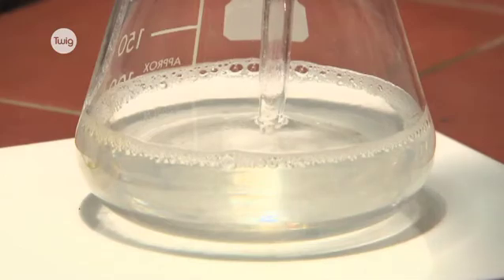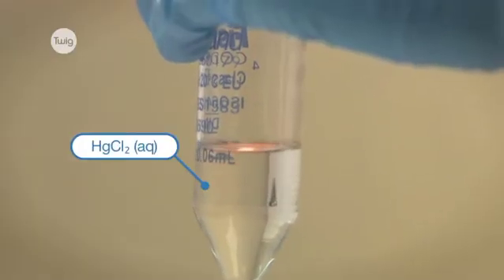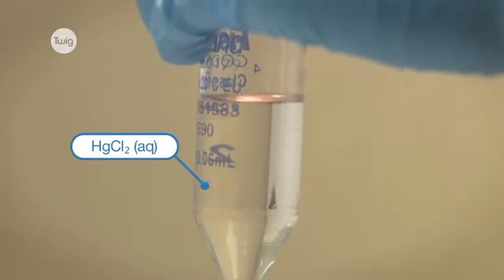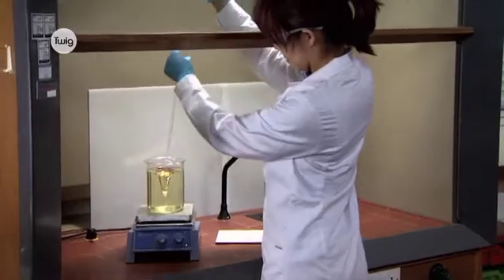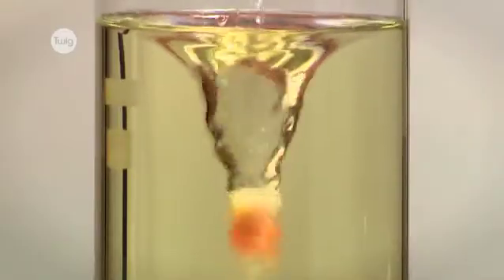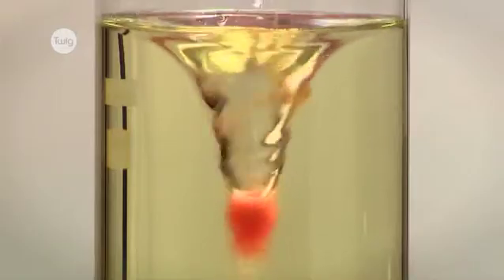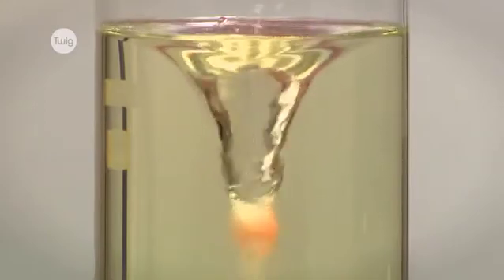Next we take some mercury chloride solution. Using a bulb pipette we add it directly into the vortex. An orange precipitate forms within the vortex and then vanishes. When we introduce more mercury chloride the cycle continues.